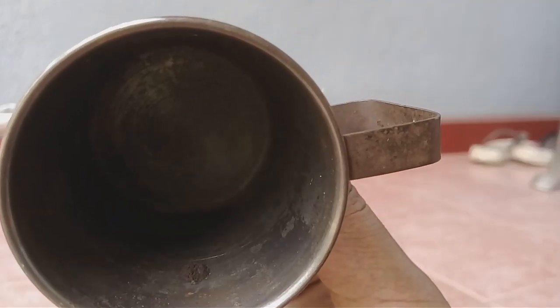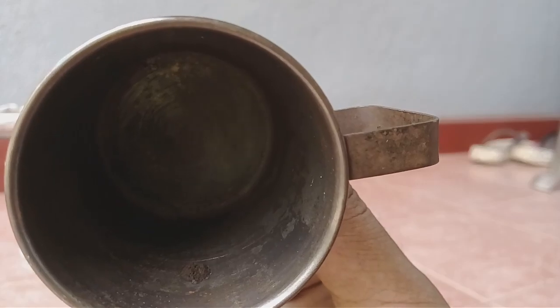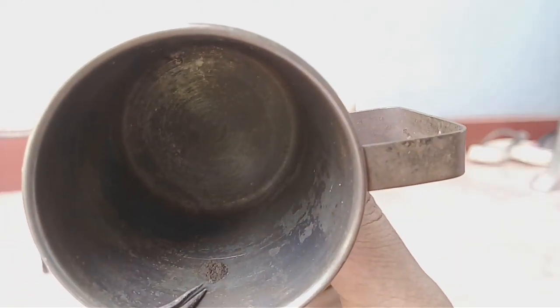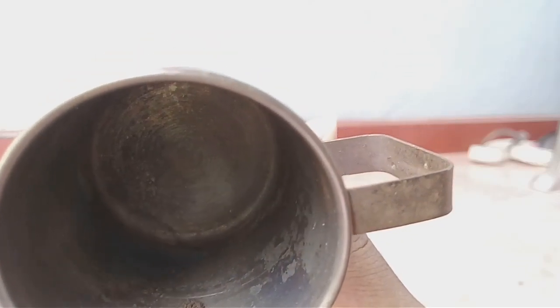I washed the precipitate and put this precipitate here. Now you can see here gold precipitate in my crucible. My crucible is broken so I use this steel container.